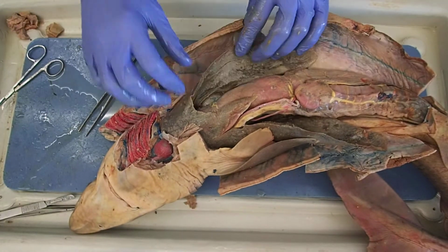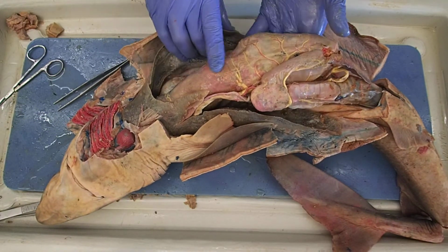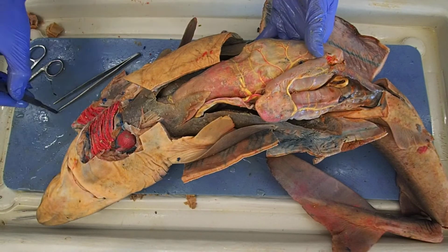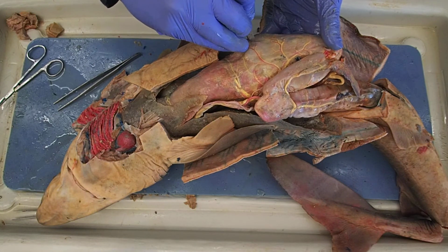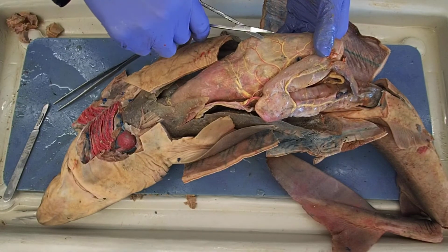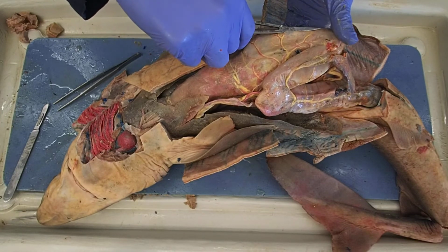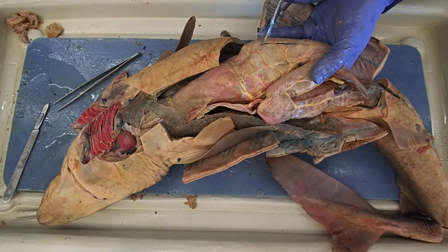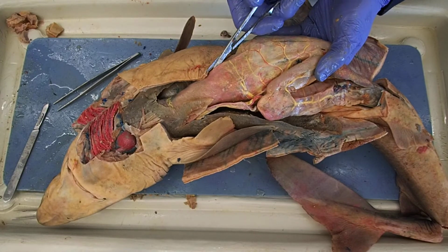One thing I wanted to show you, just because why not? So here we have our shark. Here's the stomach of the shark. Uh-oh, there's stuff in there. Let's take a look inside the stomach of the shark. Remember, the stomach is made to expand so that the shark can gorge on food when food is present.